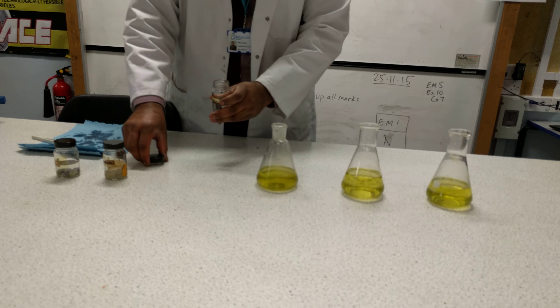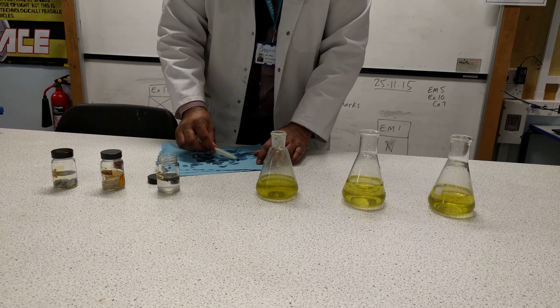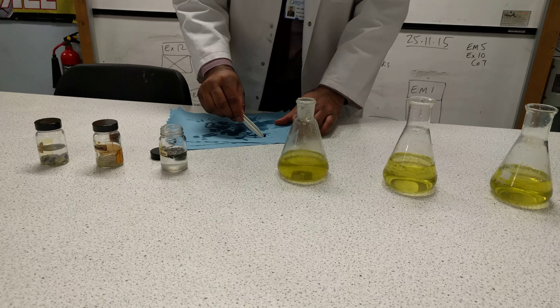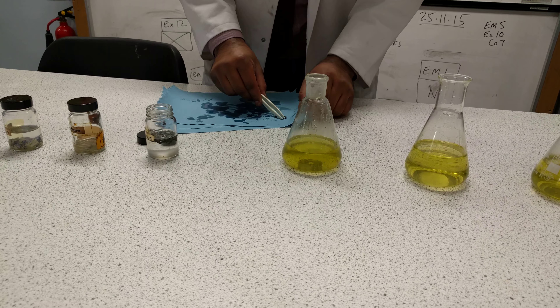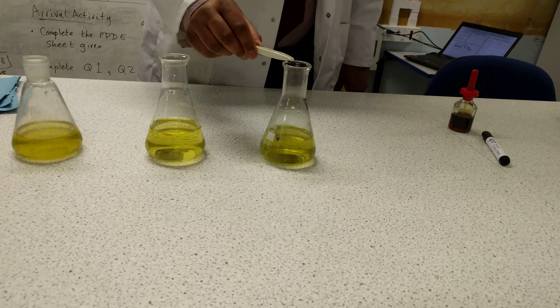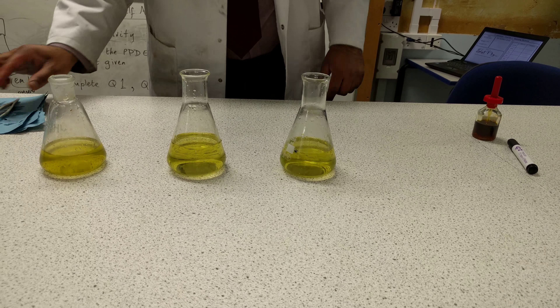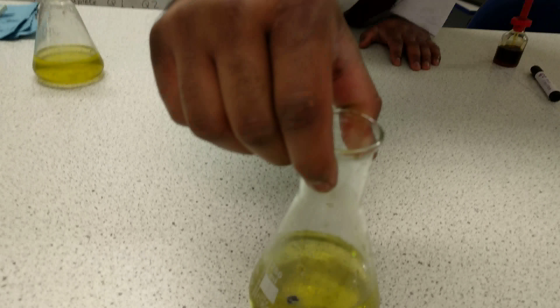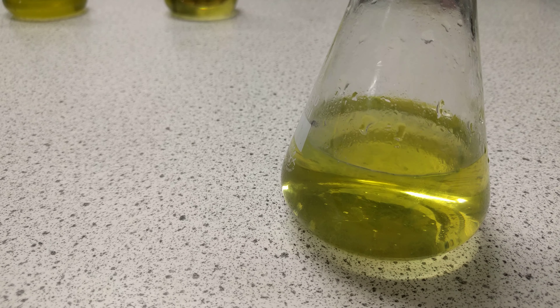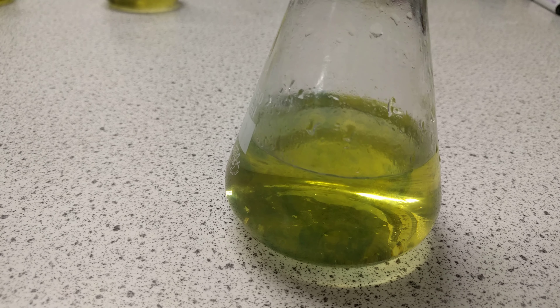The first one I'm going to take is lithium. I'll take a bit of lithium and dab it on some tissue paper to remove the oil from the surface. I don't want the reaction to be slowed down — too much oil on the surface can slow the reaction. I've got my lithium; I'm going to pop it into the conical flask. You notice the reaction doesn't happen straight away. After a while, as the oil floats away from the metal and the metal makes contact with the water, the reaction starts and lithium forms lithium hydroxide.